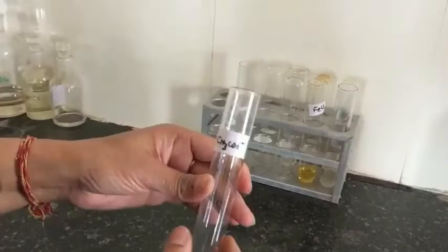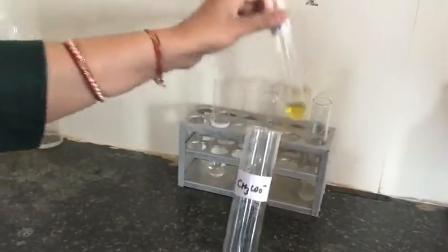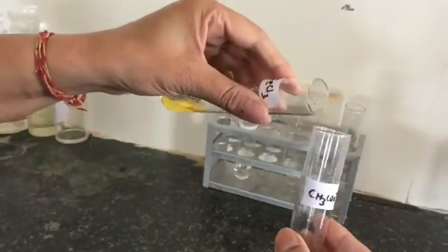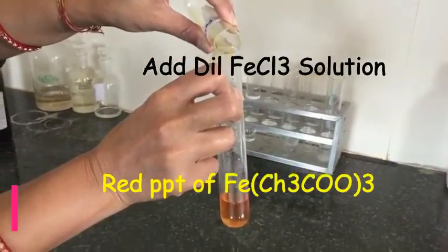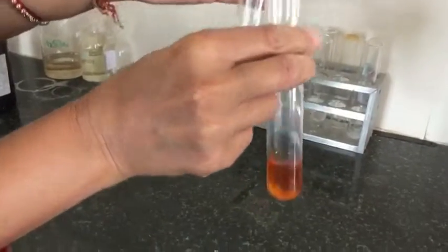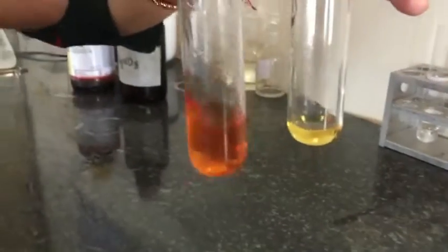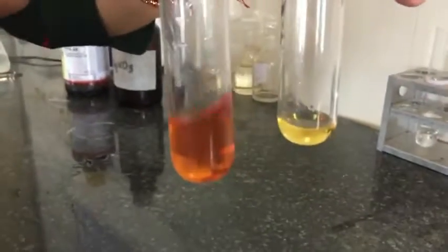Test for acetate ions. I have taken the water extract for acetate ions and to this I am adding freshly prepared, neutral FeCl₃ solution. You can see the red coloration, which confirms acetate ions.